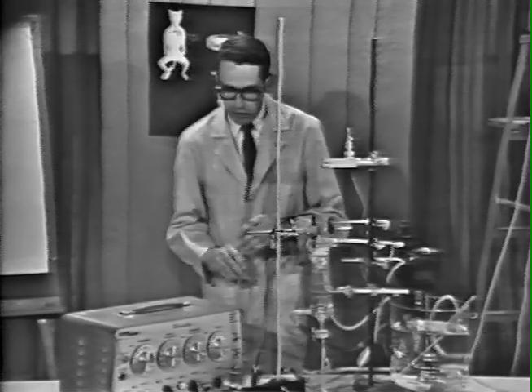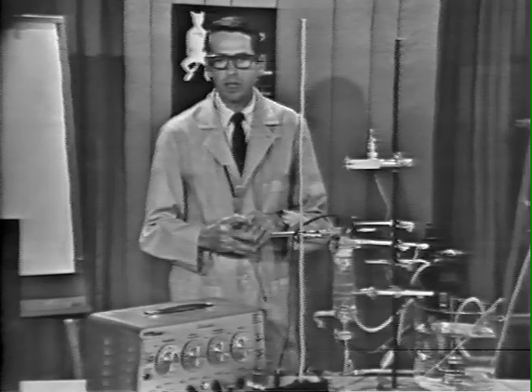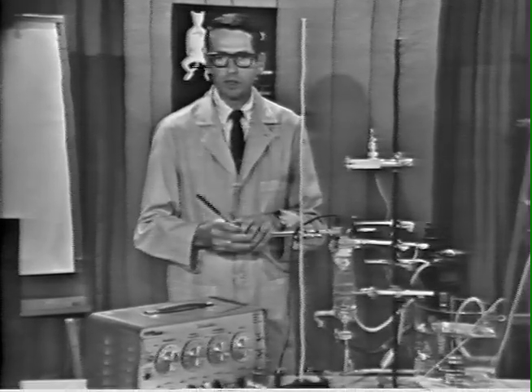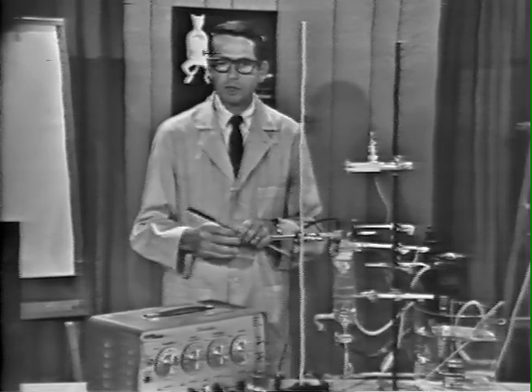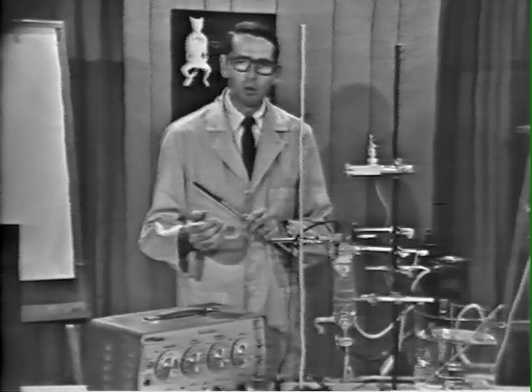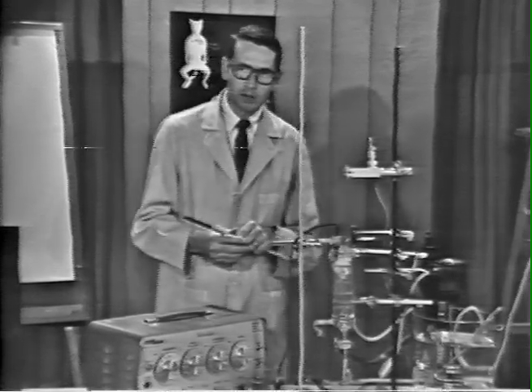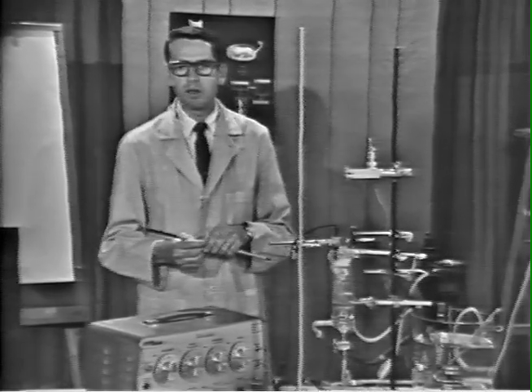Now, we can proceed with the experiment, and initially we will apply stimulation at a low stimulation frequency. The lower range of sympathetic discharge in most animals is on the order of 1/2 to 1 impulse per second. Therefore, we are going to look at a response to stimulation at 1 per second.